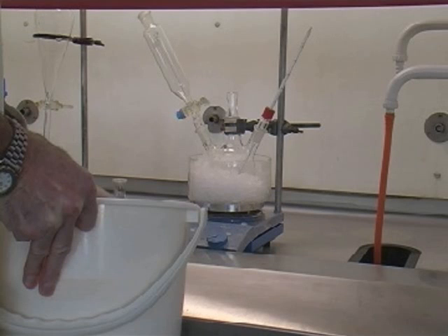Add 20ml of dichlorodimethylsilane and 40ml of diethyl ether to the round bottom flask and cool to below 15 degrees centigrade.